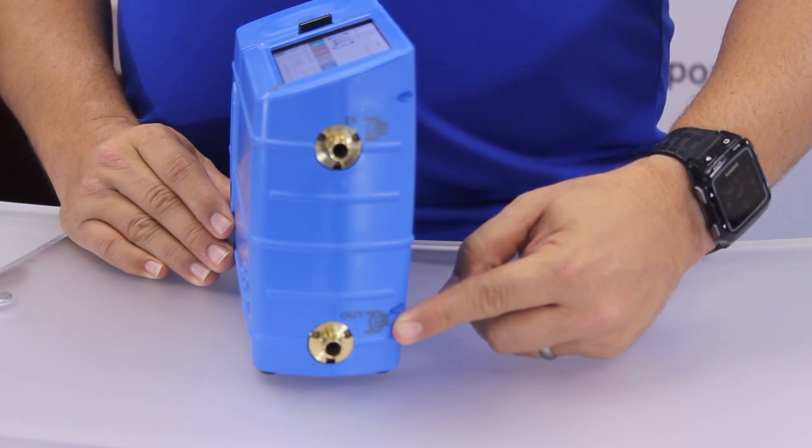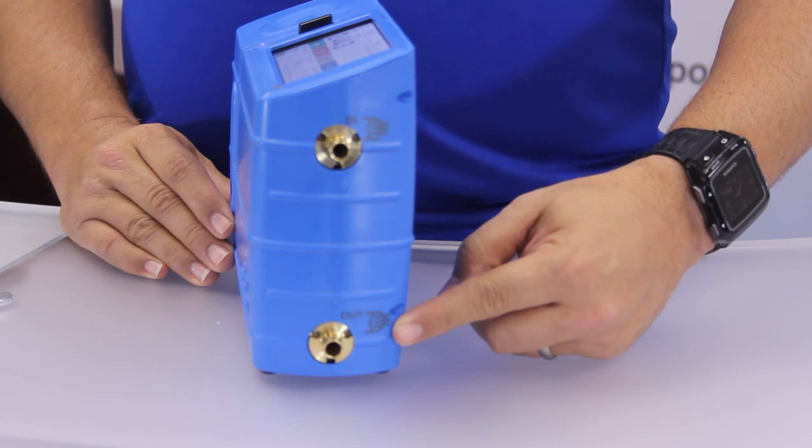L is the outlet barb, located on the bottom side of the base. It is connected to an air source pulling vacuum via the media and sampling train.